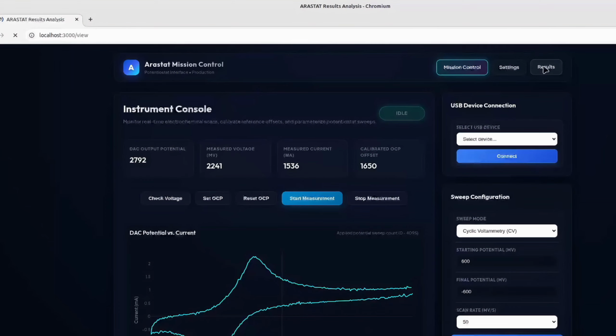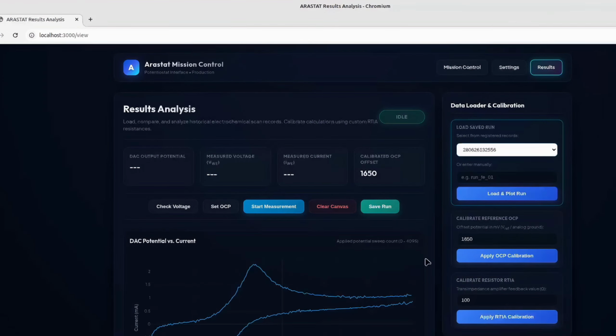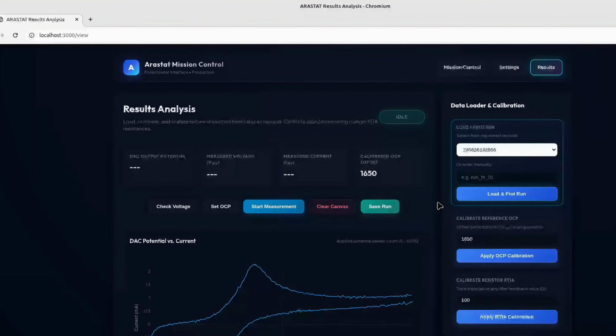We can also look at our previous experiments and results by entering the file name from the data folder, and the data would be plotted. So far, that's how we communicate with our Potentiostat devices using a web app. It's not finished yet, but we'll improve it as we go.